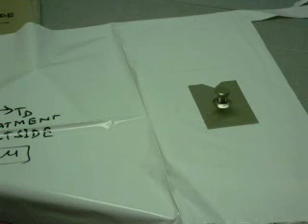A film sample attached to the sled is cut to approximately 120 millimeter or 4.5 inch square. Film is defined as sheeting having a thickness of not greater than 0.254 millimeter or 10 mil, as indicated by ASTM standard D883. A sheeting specimen greater than 0.254 millimeter thickness or other material that is to be attached to the sled is cut to 63.5 millimeter or 2.5 inch square.